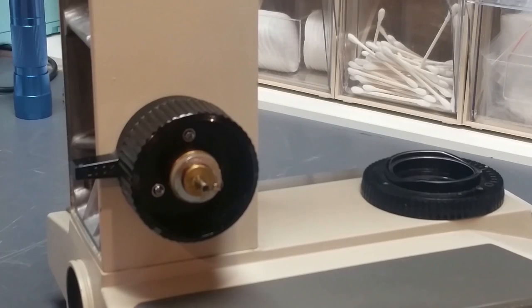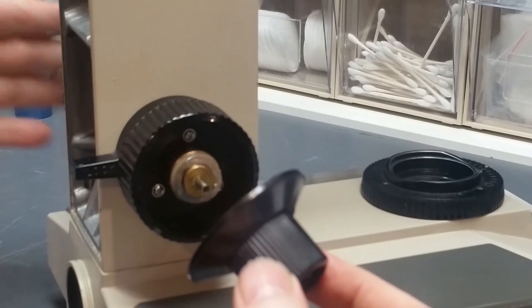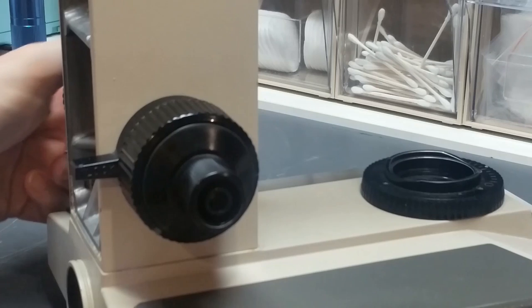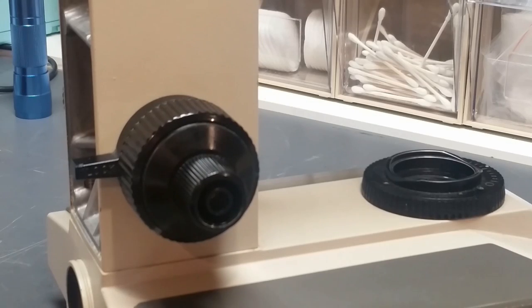All that remains to be done is to take this, I'm going to hold this shaft, I'm going to reach around the back and hold the fine focus shaft so that it doesn't push back, and I'm going to take this knob, put it on there. And all that remains is for me to put a screw in there to hold it in place. And hold the phone while I find that screw. Okay, it had rolled into a devilishly obscure location, but it has been located.